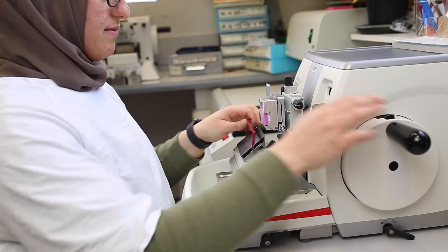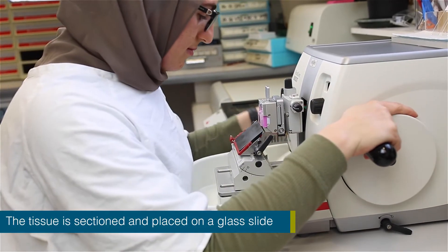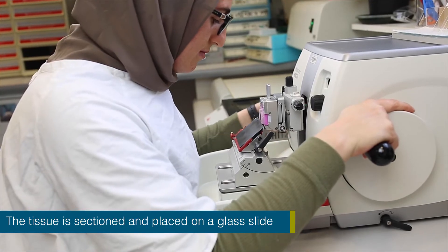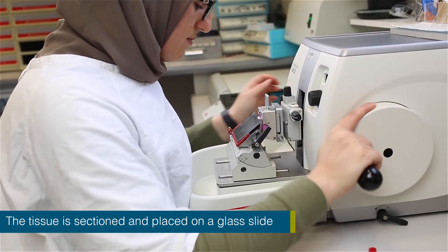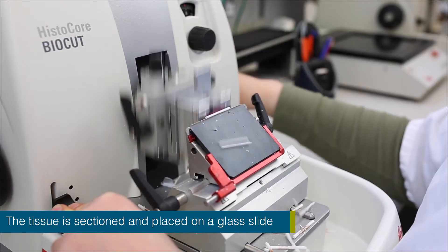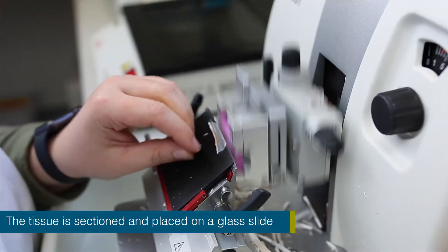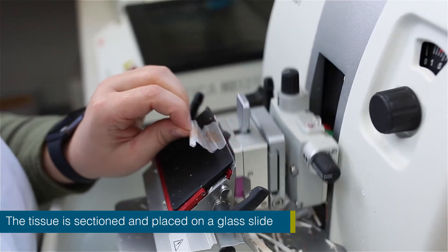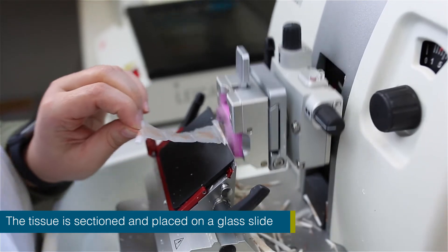Sectioning involves the tissue block being placed on a microtome, where an experienced lab staff will section the tissue block containing the processed tissue in solidified paraffin wax. Tissue sections for light microscopic examination are usually 4 micrometers in thickness.